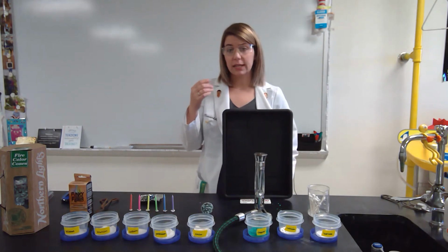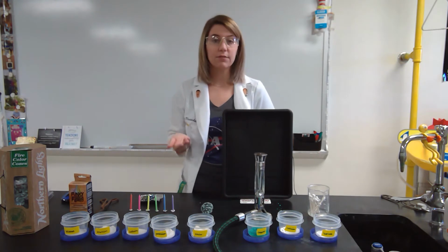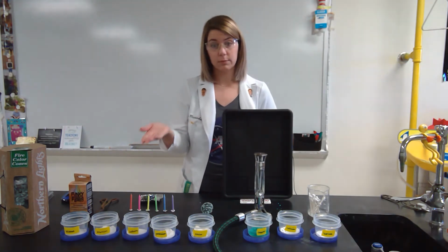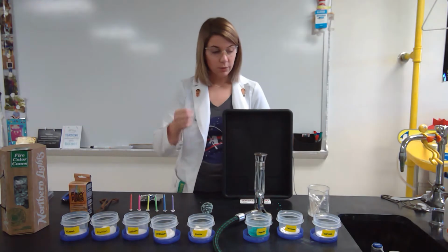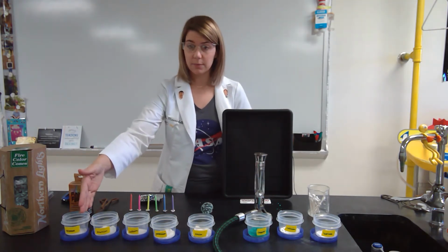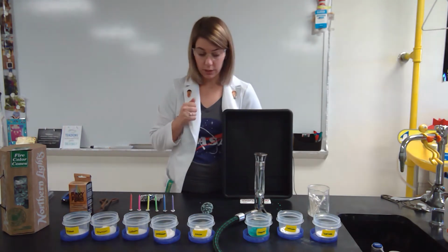And then those electrons, whenever they release that energy to go back down to the ground state, they give off color. So we're going to use the flame test as a way to determine what the element is, because each element has its own flame test. And so we're going to test known samples of elements. We're going to test an unknown sample. The unknown is going to match one of these samples that we do know.